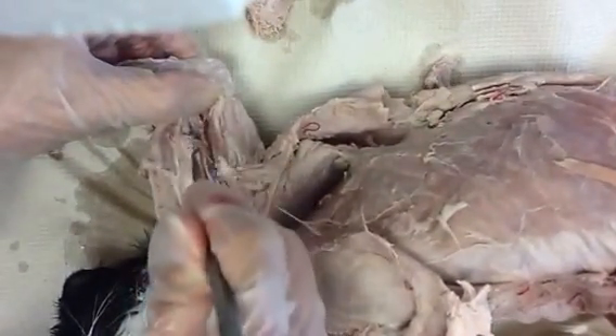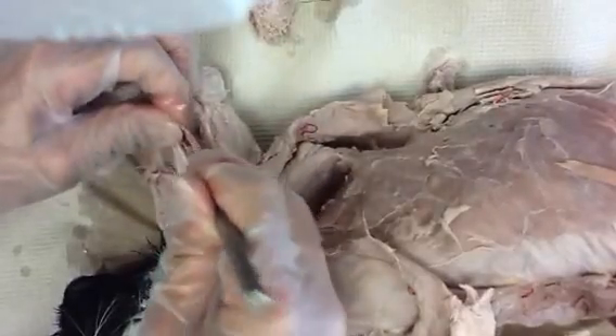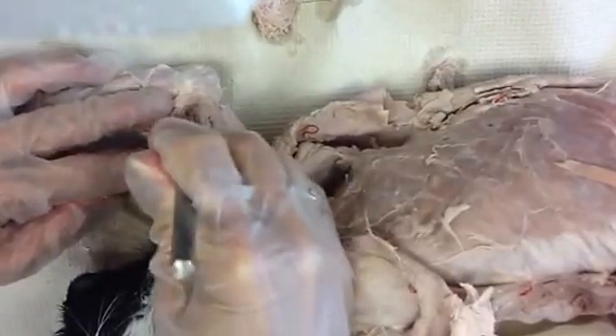The connective tissue on a tendon, on a fascia, on a muscle has a nice shiny iridescent quality. The nerves will look dull — they will not be iridescent and reflective looking like that. Ann is working feverishly over here on the antebrachium, and we'll show that in a minute because you can see how the shiny connective tissue is different from the nerves.